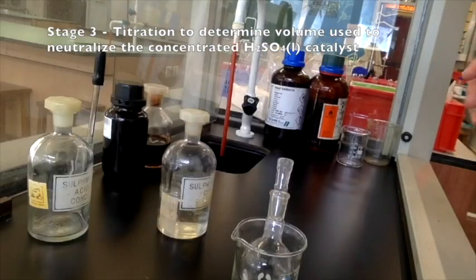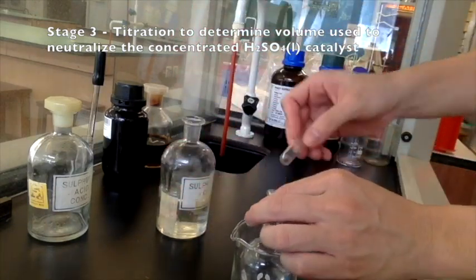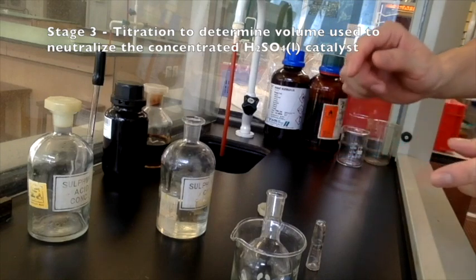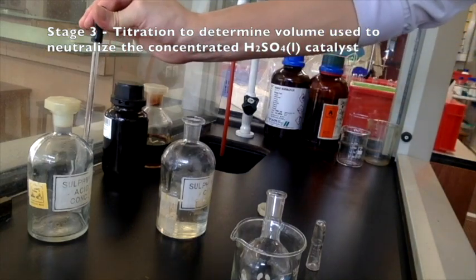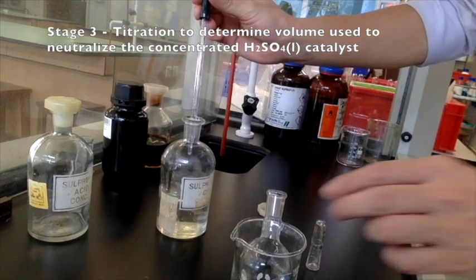Now, for the concentrated sulfuric acid, we must add it inside the fume cupboard. We will have to add 8 drops of it. Now, again, once you have added the concentrated sulfuric acid, you should transfer the mixture as soon as possible into the conical flask. Otherwise, the reaction may already start. Part of the ethanoic acid may have been consumed.